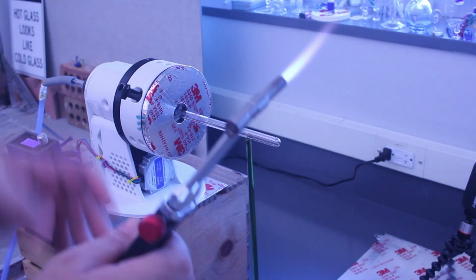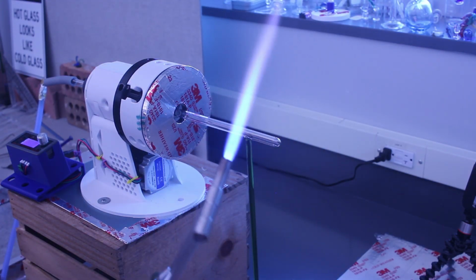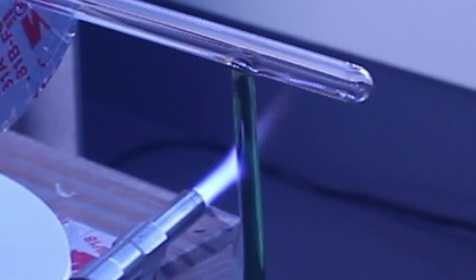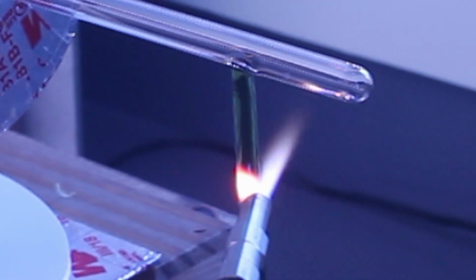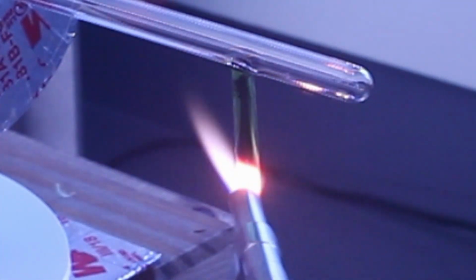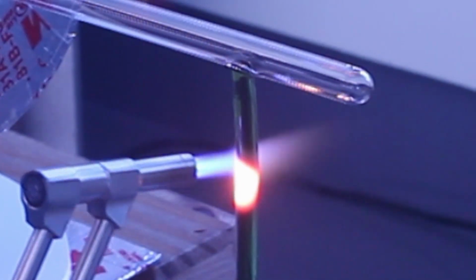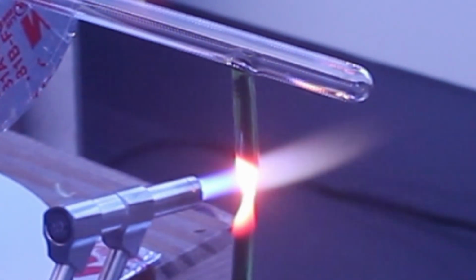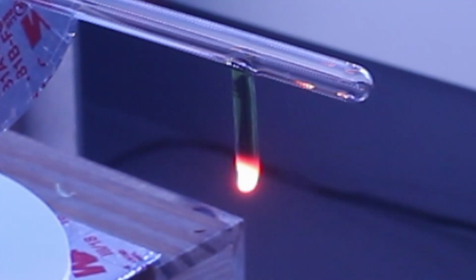Now at this stage, what I'm going to do, so I'm going to increase this. I'm going to come in here. I'm actually just going to remove the green glass. Or I should say I'm going to cut it, not remove it. You can see it's starting to get soft. So this is just a fire cut. They're more intense than it needs to be. Okay, and I'll put this aside.